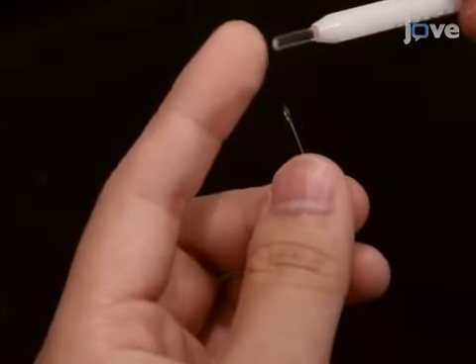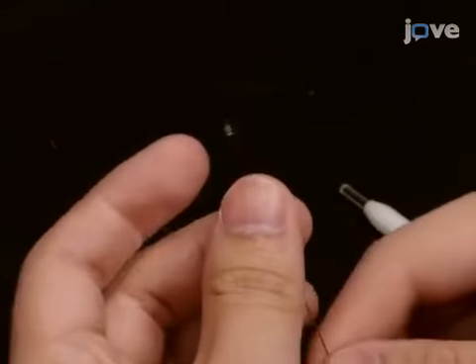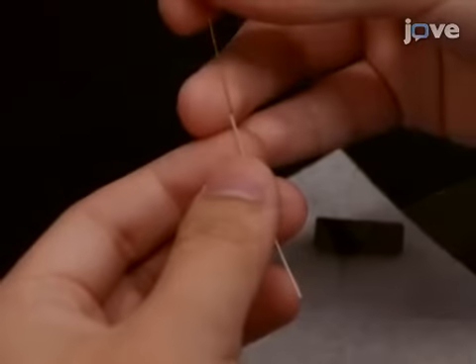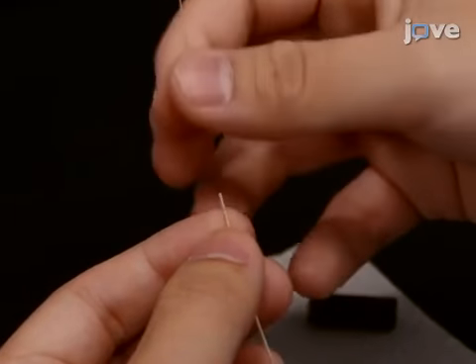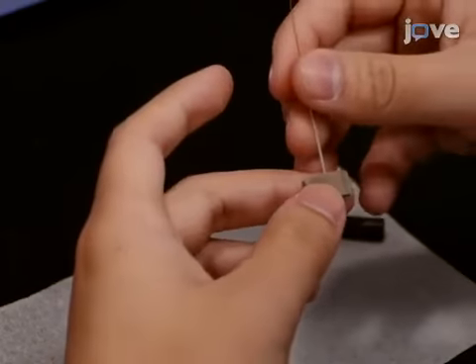Next, cut the inserted capillary to a length of about 10 to 15 millimeters. This end will act as the electrospray ionization emitter. Insert the opposite end of the larger diameter capillary into a 1/32 inch PEEK tube that has been pre-cut to between 4 and 5 centimeters in length and connected to a PEEK union.